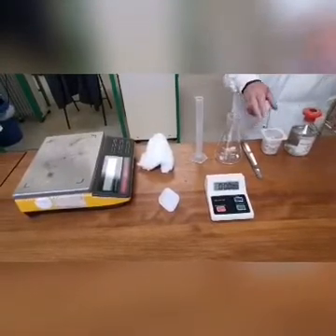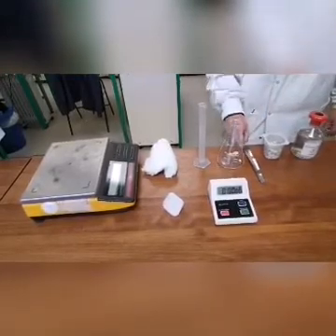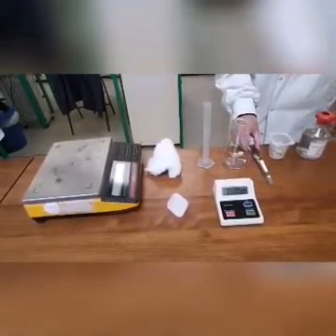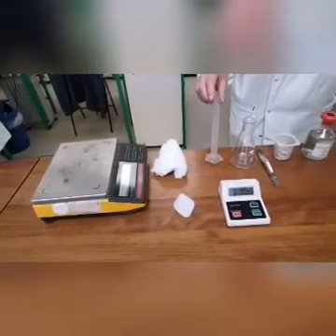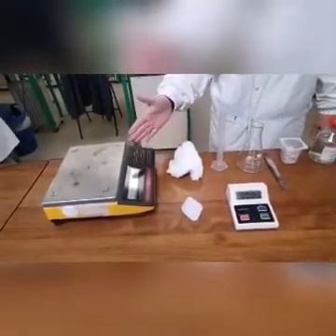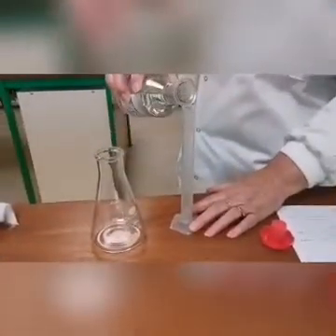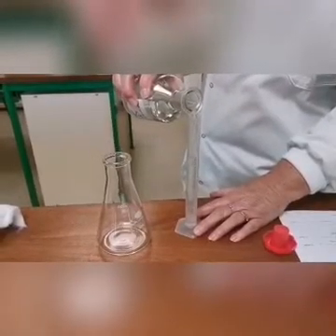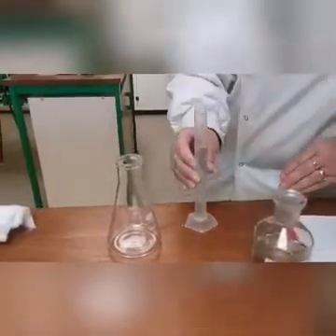For this you will need 1 molar hydrochloric acid, calcium carbonate, known as marble chips, a spatula, a 250 cm³ conical flask, a 25 cm³ measuring cylinder, cotton wool, a 2 decimal place top pan balance, a weighing boat and a timer. Procedure. Measure 25 cm³ of 1 molar hydrochloric acid using a 25 cm³ measuring cylinder and pour it into a 250 cm³ conical flask.